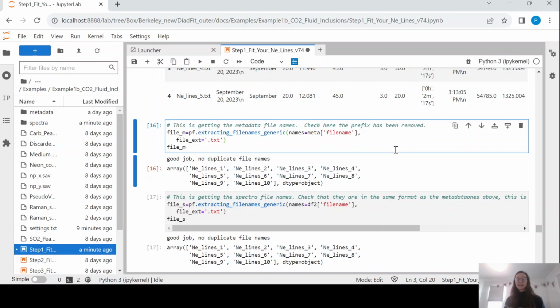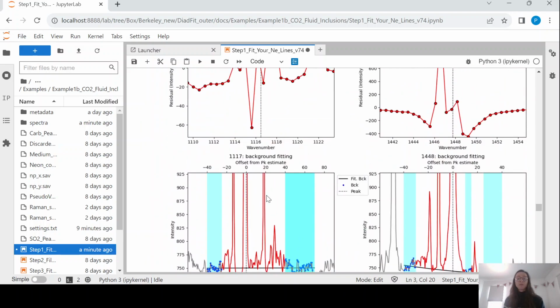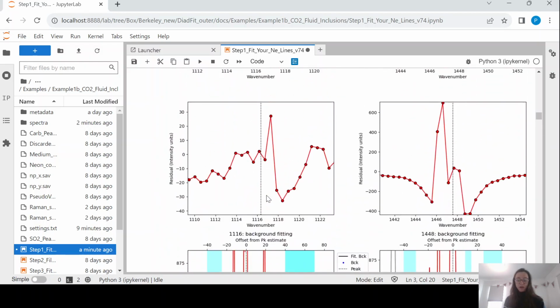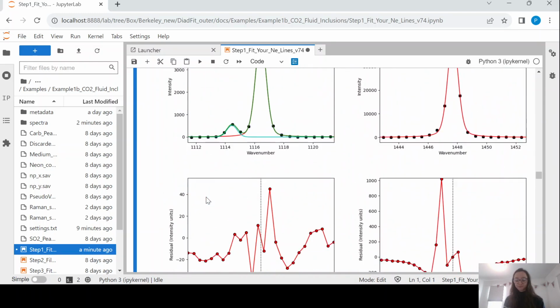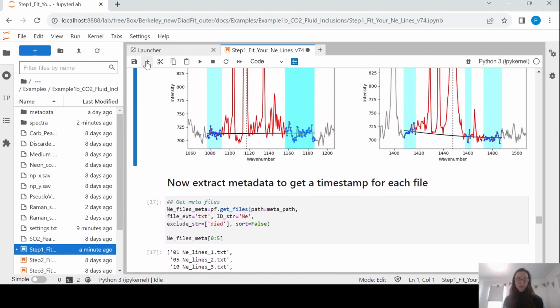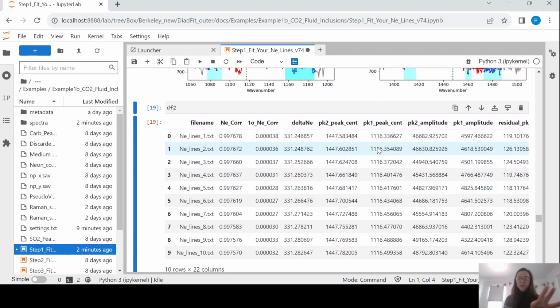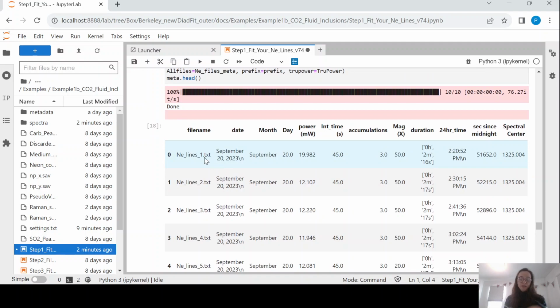So we now have a data frame which is our metadata, and we also have a data frame which is our peak fits. So we can just go up here and have a look. This data frame is called df2. Okay. So let's just have a look at these so you understand the next step. Okay, so this has a file name, and it has all of this peak fit information for the neons we want. We also want to merge it with this data frame.